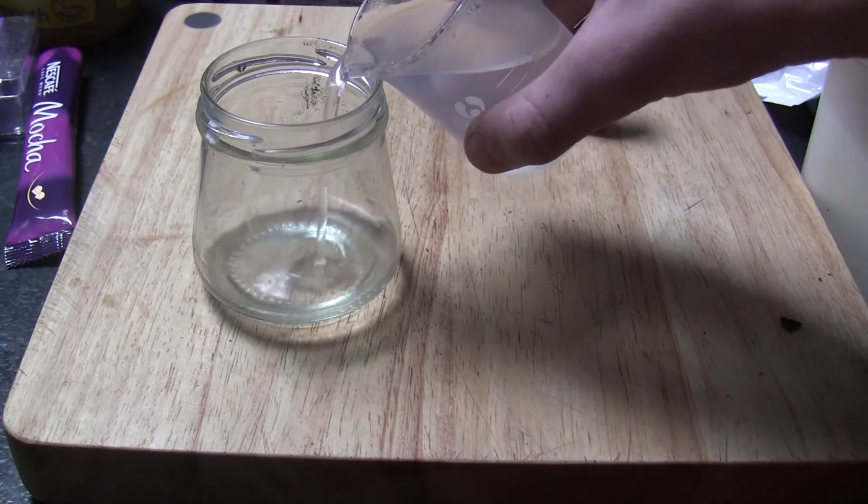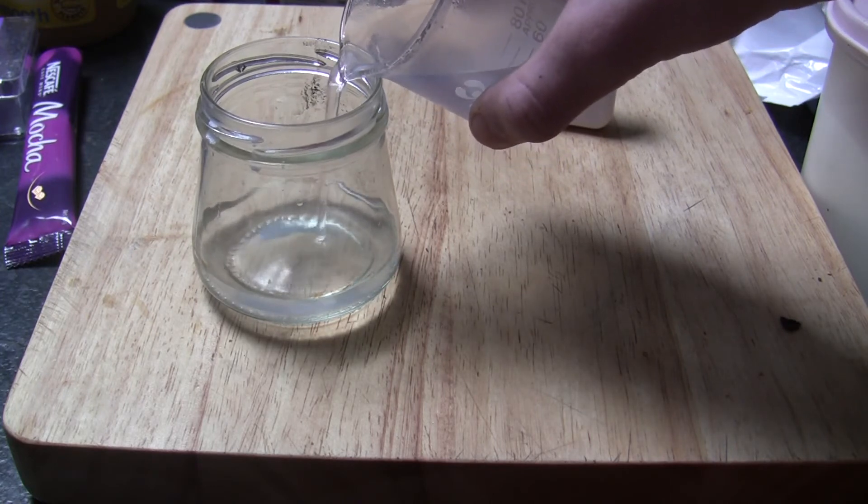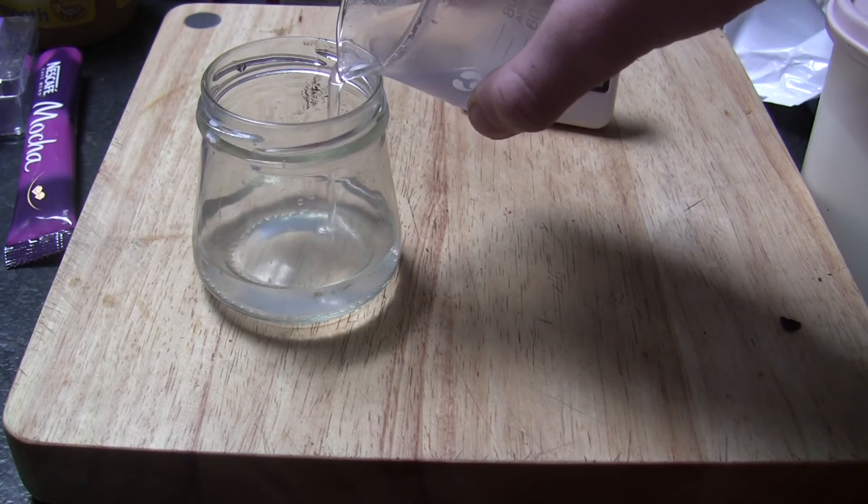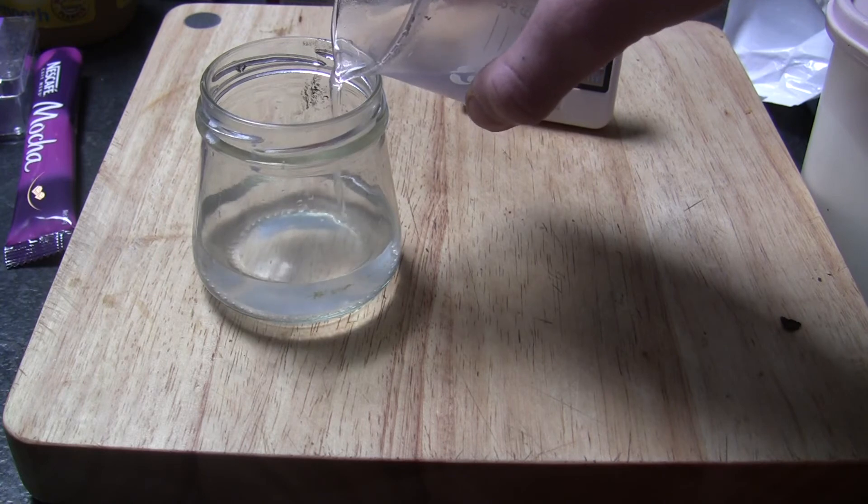I'm just decanting for now because I only got a small batch here and it's not really enough for wasting some filter paper.